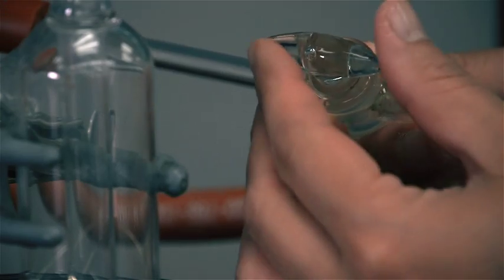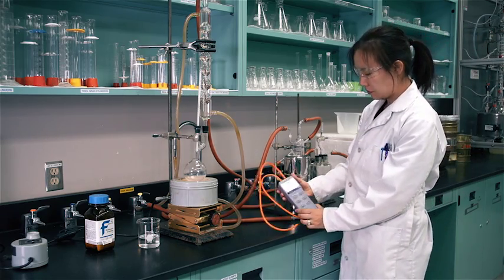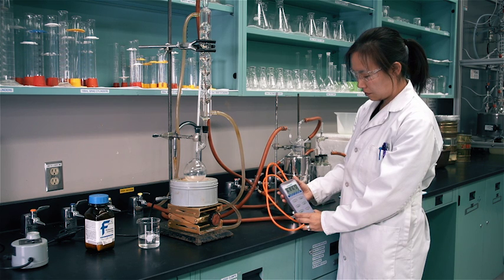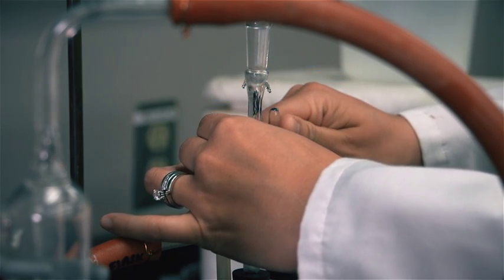Close the stopcock that leads to the vacuum pump. Observe the manometer reading for about 30 seconds. The system is air tight if there is no change in the manometer reading. Open the stopcock on the top of the safety bottle to fill the apparatus with air.